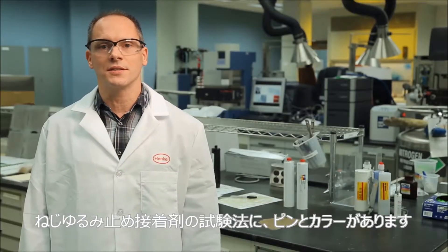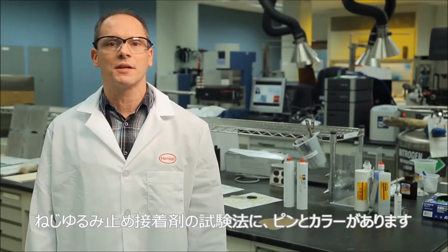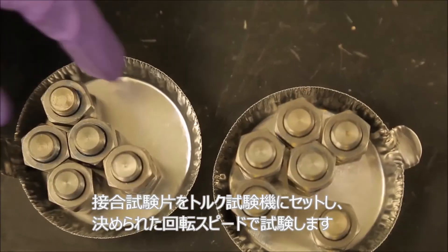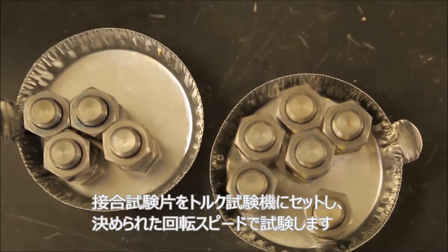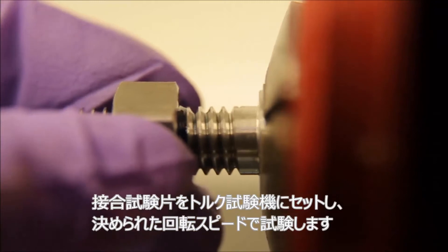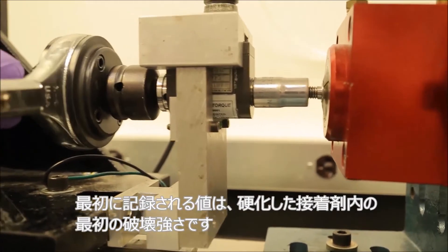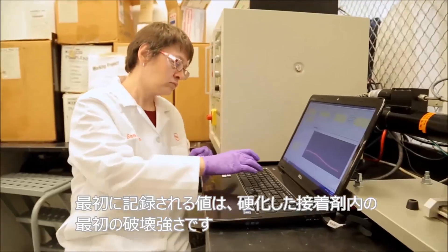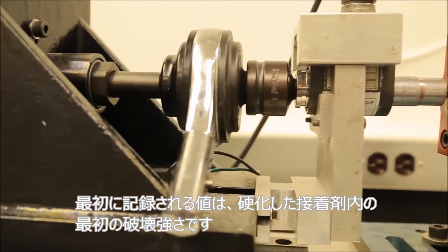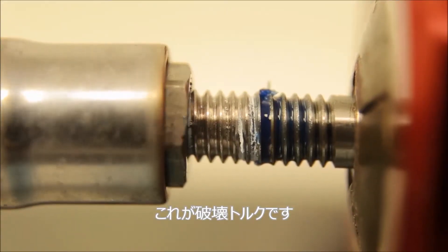One way we test these adhesives is by using straight threaded fasteners like nuts and bolts. A bonded assembly is seated in the torque tester and tested at a defined rotational speed. The initial result recorded is the strength of the first break in the cured adhesive — this is the breakaway value.